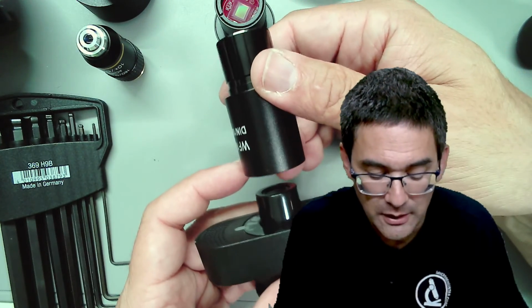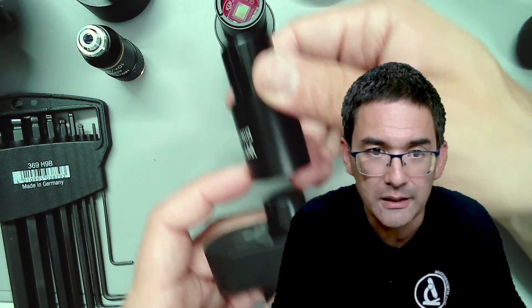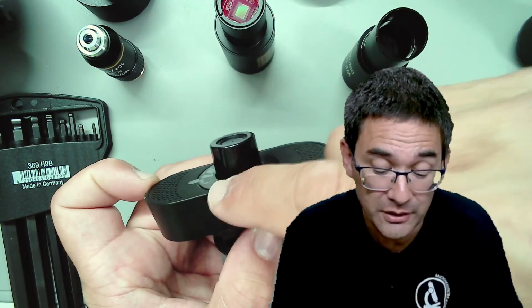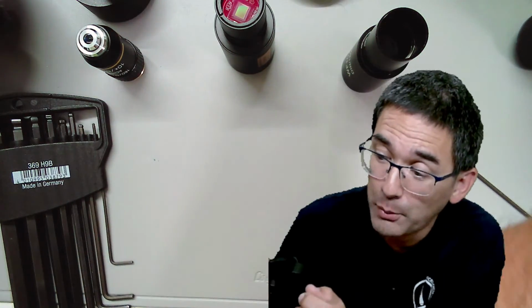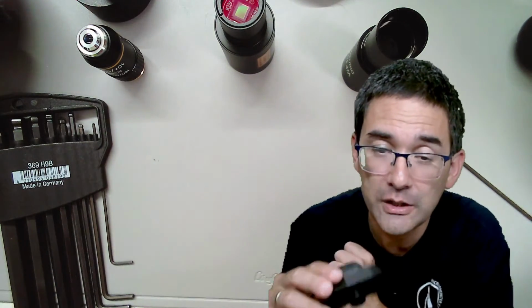Then you have your own dedicated camera all set up, and if you want to use it, you just plug it in using the separate eyepiece. Or, a second possibility, you take it apart, detach the lens, and attach it as close as possible to the tube, so that you get a direct projection into the webcam.